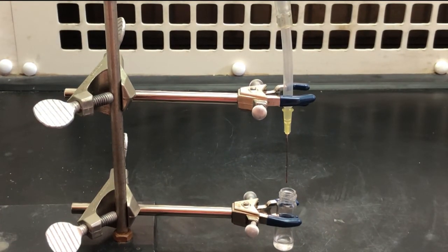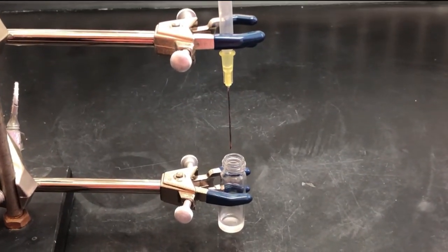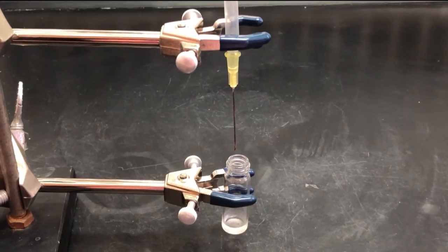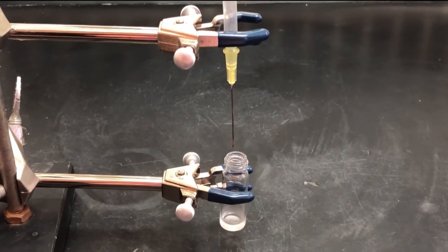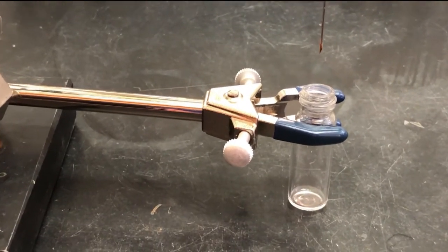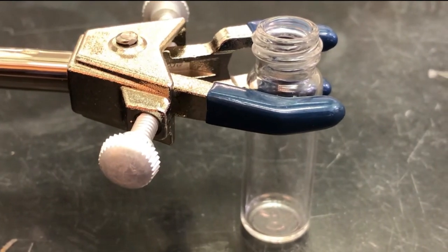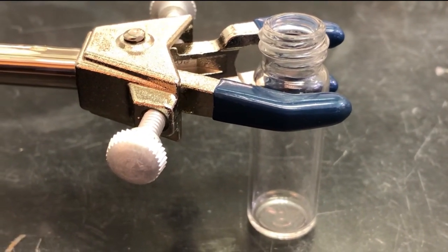Second, dry to constant weight, meaning that you weigh the product in the vial, put it back under nitrogen gas for 5 minutes, and weigh it again. If the weight remains constant, this indicates all of the solvent has evaporated. Label the capped vial and leave it on your benchtop. Your instructor will evaluate the remaining product by IR spectroscopy for you.